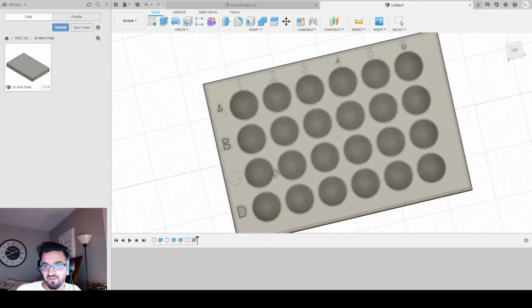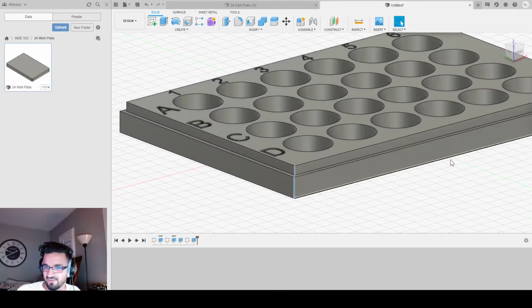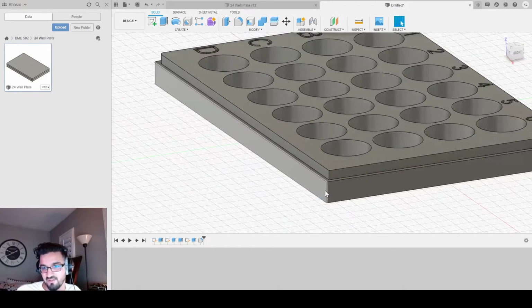We're almost done with the plate, not quite yet. The next thing we're going to have to do is essentially fillet these corners. And I like to select them all at once, but for the sake of this video, I'm not going to do that. So I'm just going to select 2 at a time. And I'm going to fillet these by hitting F by 1.5. And you'll see that that'll round out this edge. So it's not a sharp corner. That's all it does.